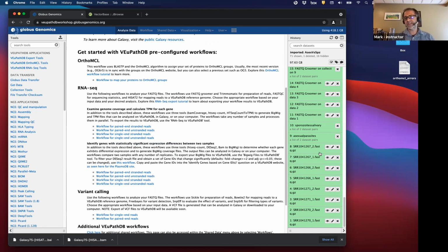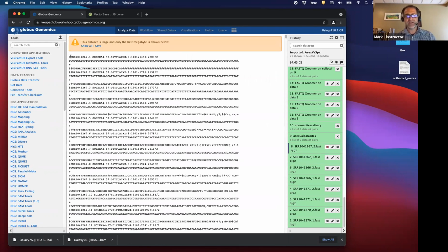So when you get RNA-seq data, if you do RNA-seq experiments yourself, you're going to get FastQ files. So I just want to reiterate what FastQ files are and look at a FastQ file and what they mean. We downloaded FastQ files from EBI, and if you have FastQ files in your history, you can look at them with the view data, and you can see the format of these files. These are the files that come off the machine.